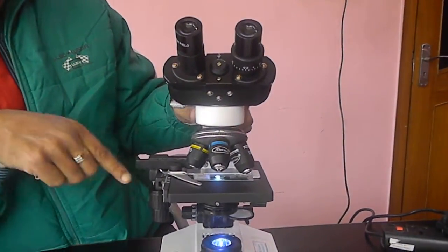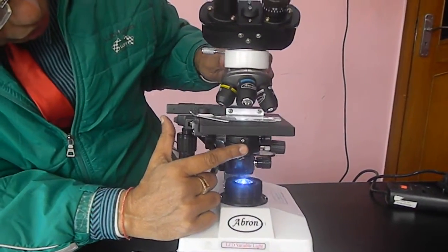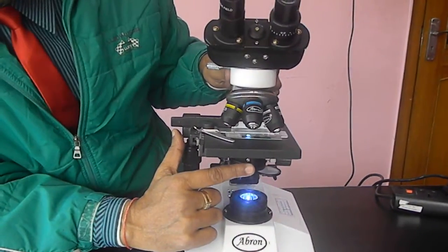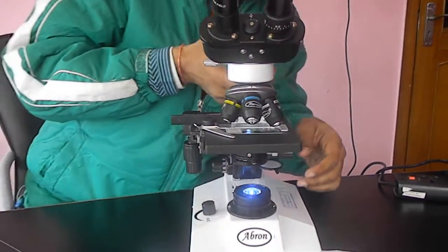Now, next step is focus. After focusing, adjust this iris diaphragm so that you have the maximum clarity of the slide.